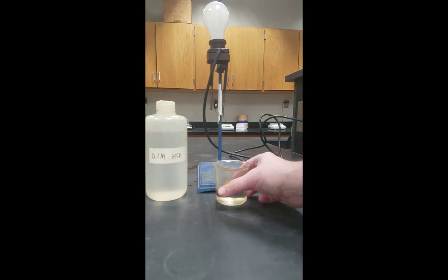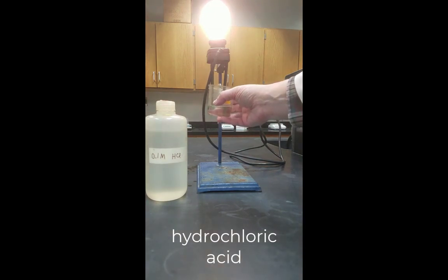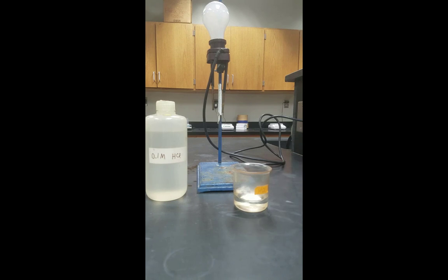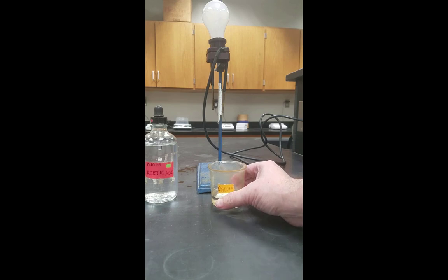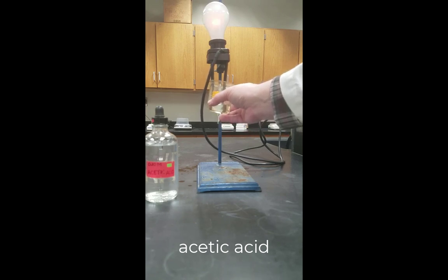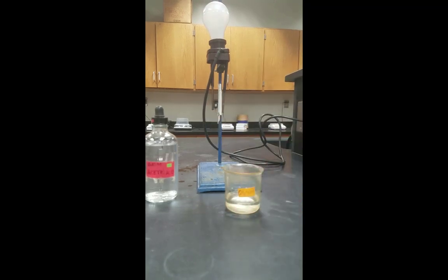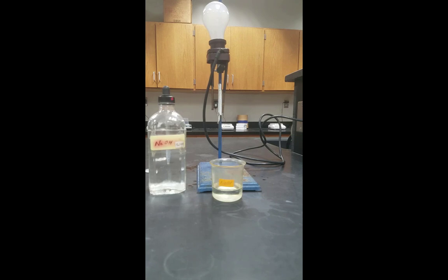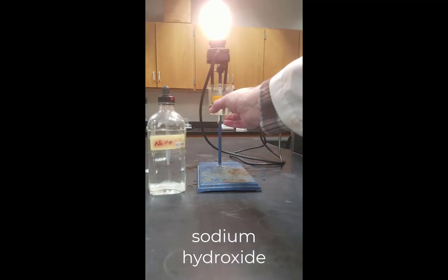How about hydrochloric acid? Notice the bulb glows very brightly. Incidentally, I'm not showing the cleaning steps in the video right now, but these are being cleaned in between. Here is acetic acid. And you'll notice that the bulb does glow just a little bit. Here is sodium hydroxide. Again, the bulb glows very, very brightly.